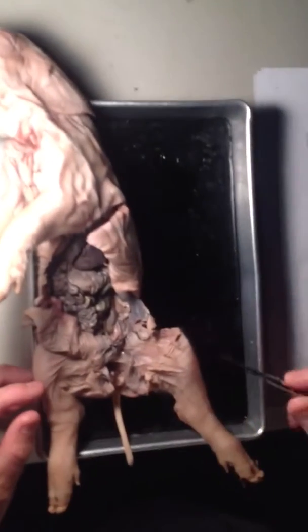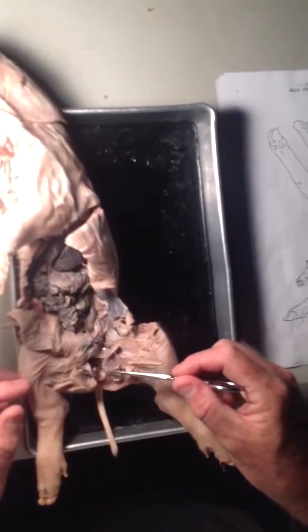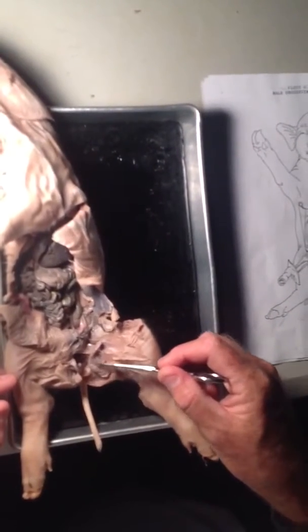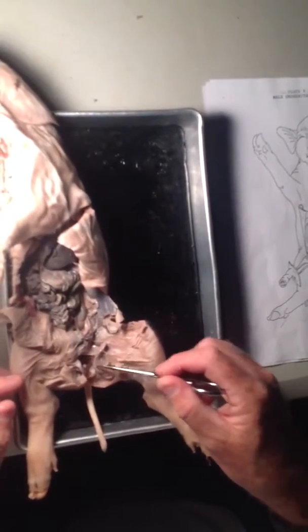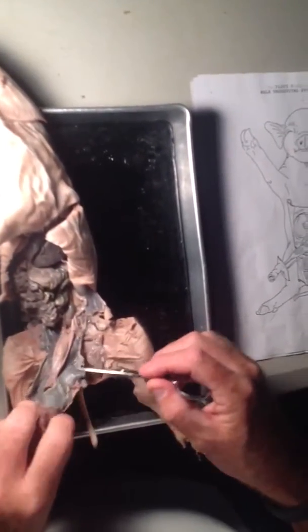The testy is right here. The epididymis is right below it. Actually, I am wrong — the testy is this little lima bean shaped thing. The epididymis is up because it actually comes up and back around. So: testy, epididymis, spermatic duct. The spermatic duct goes up to the penis.